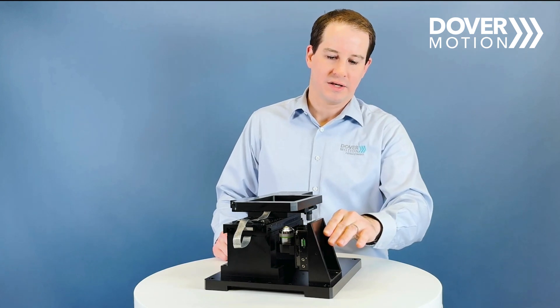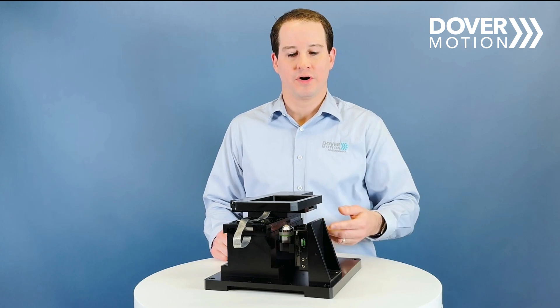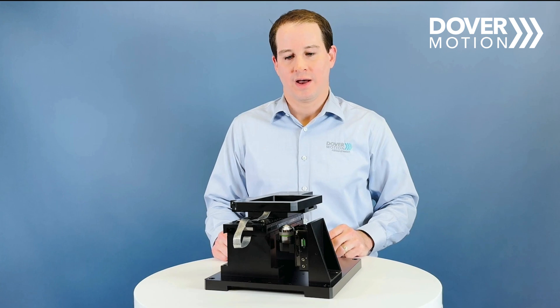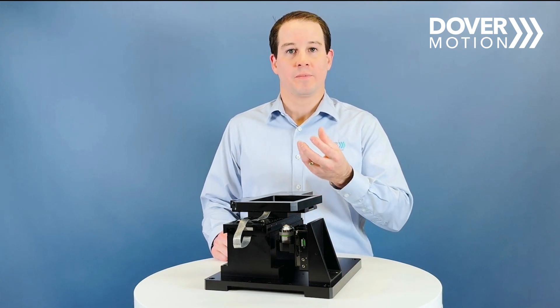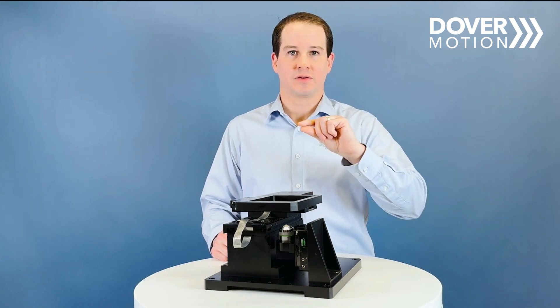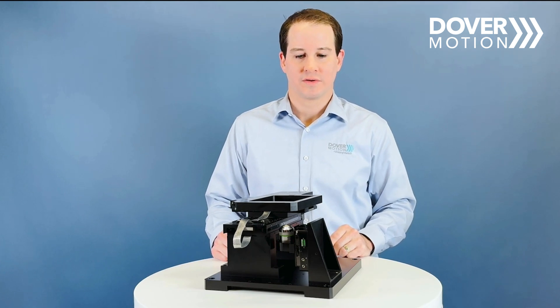Down below, what we're showcasing here is an inverted microscope setup. In an inverted setup, the camera and objective are going to be below the sample. That's useful for imaging when you have a sample at the bottom of your well plate and you want to image that lower portion. Typically you would use this inverted setup for those situations.